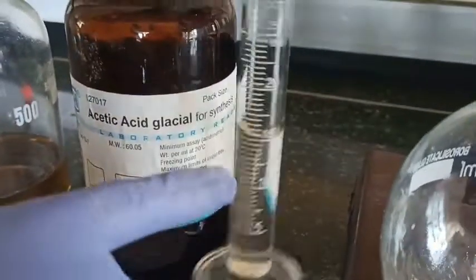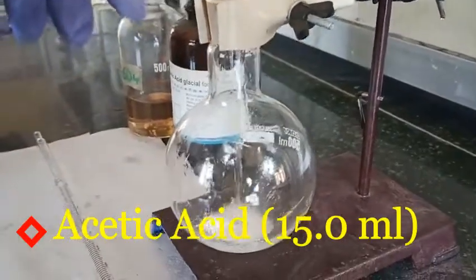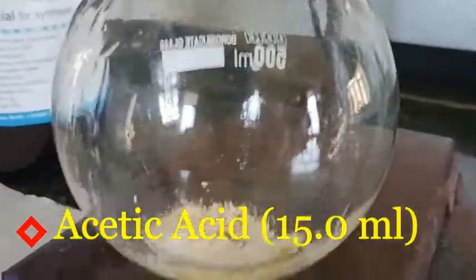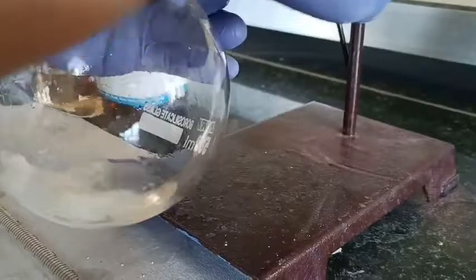To this salicylic acid we are going to add 15 ml of acetic acid. I am adding this 15 ml of acetic acid to the 2 grams of salicylic acid already taken in the round bottom flask. I shake it thoroughly to dissolve it, shaking vigorously just to dissolve the salicylic acid into the acetic acid. Here you can see some undissolved part remains.